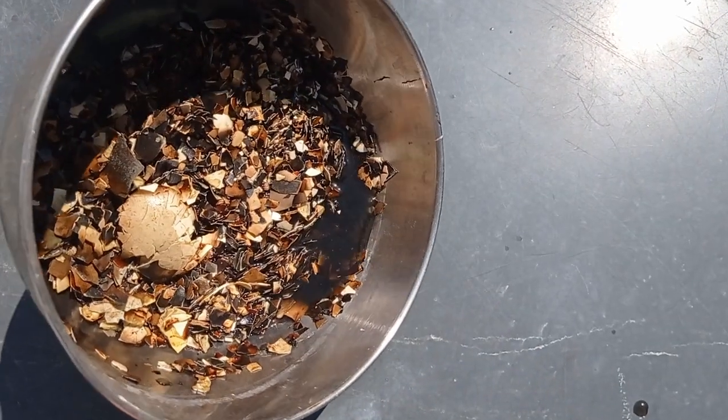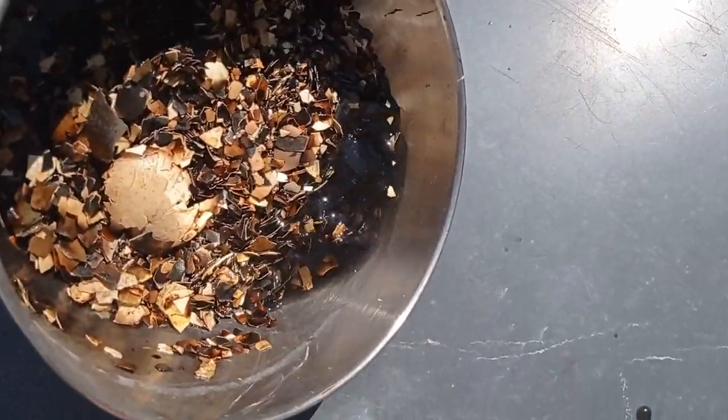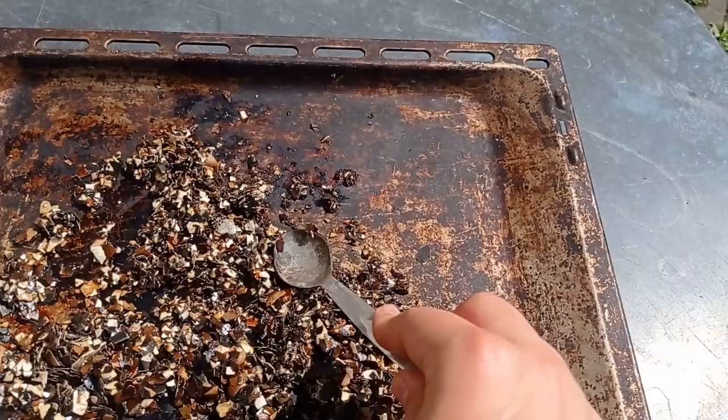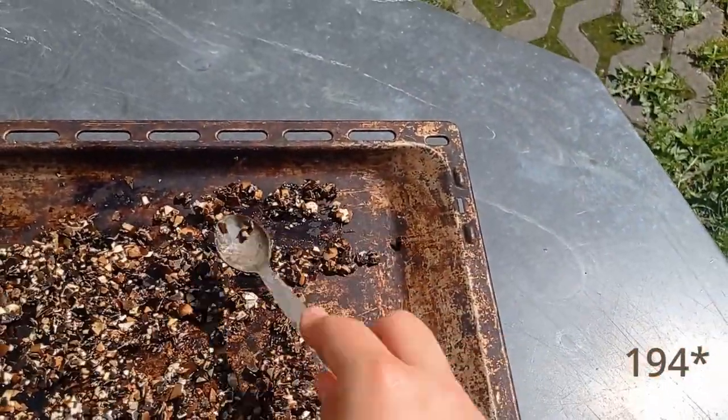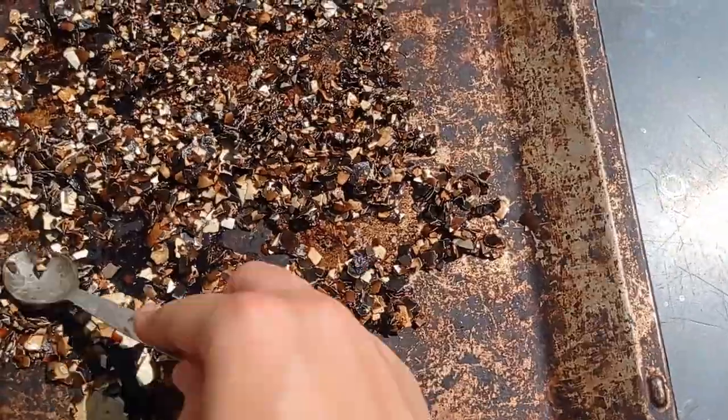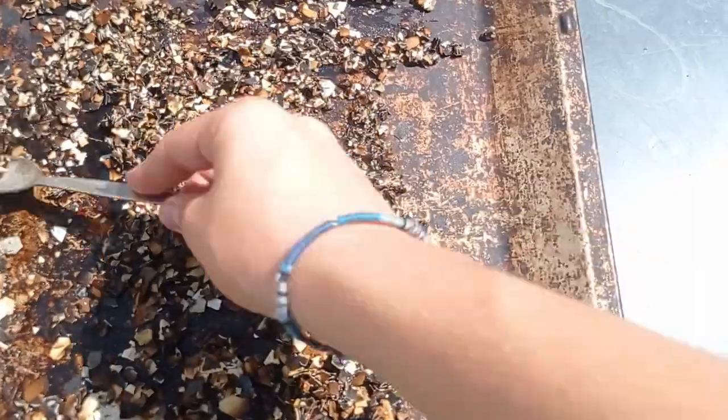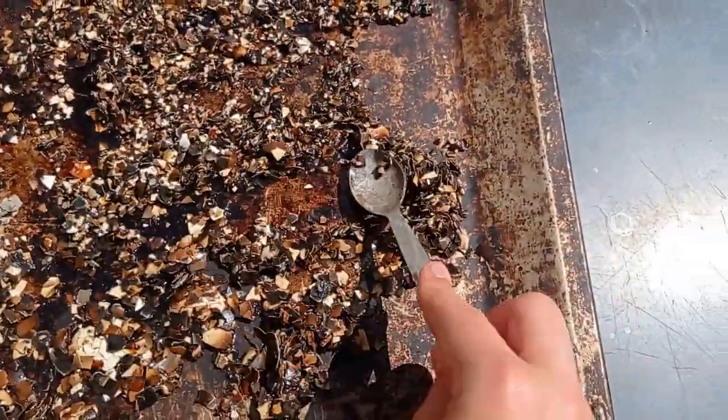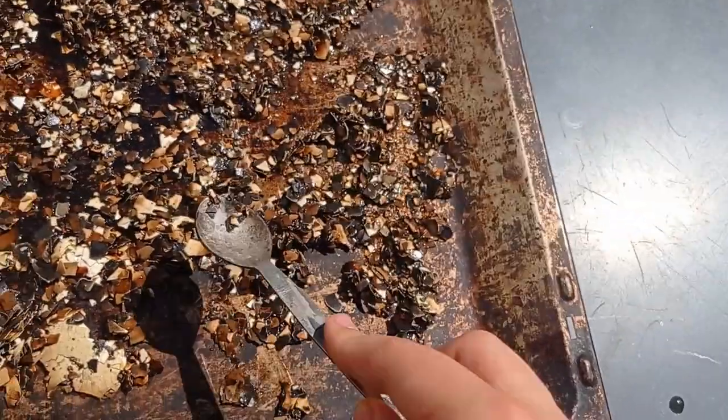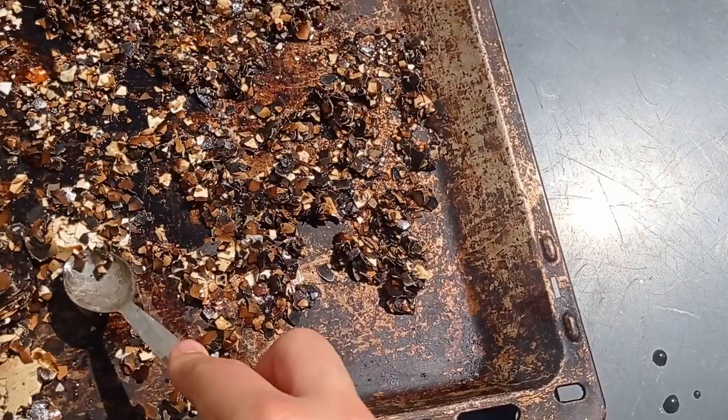Off camera I burnt eggshells and with great force of sun I dried it, and it turned out there's 192 grams of dry eggshells. I need 274 grams of 80% acetic acid, and naturally you can use just vinegar 10% or 5%, and later it turned out that this would be better to use.